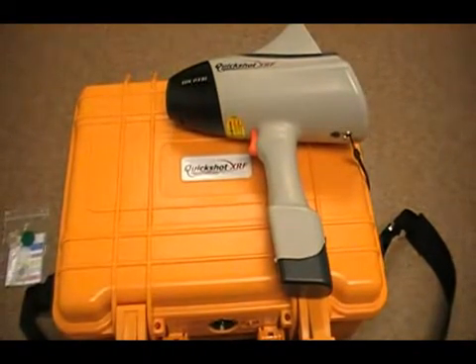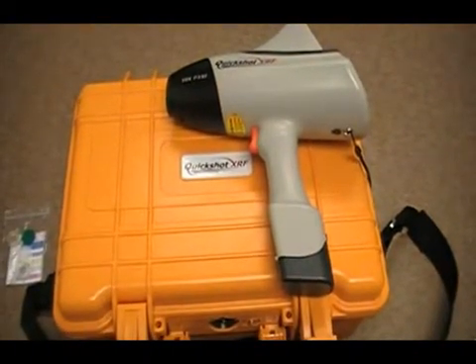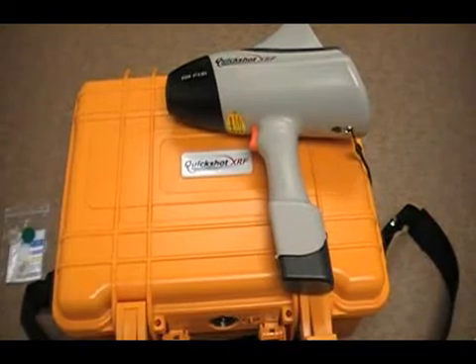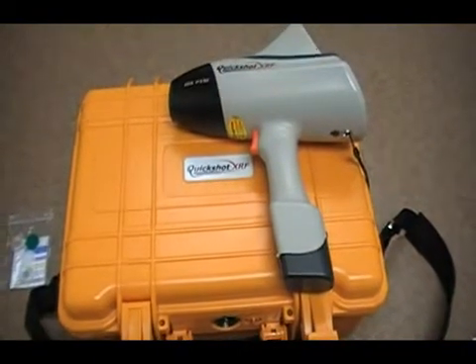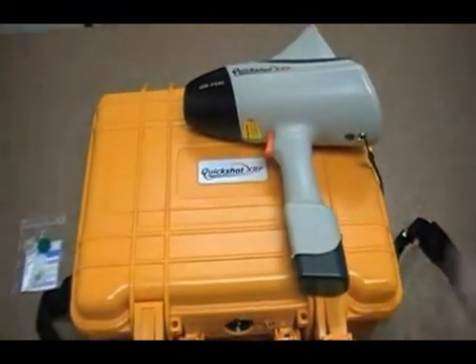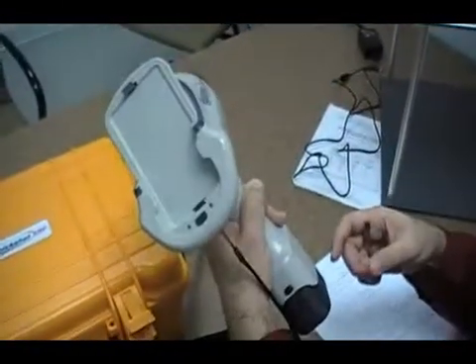Today we're going to cover the operation of the handheld unit for hazardous substance analysis. The first thing you would do is take the handheld unit out of the container.